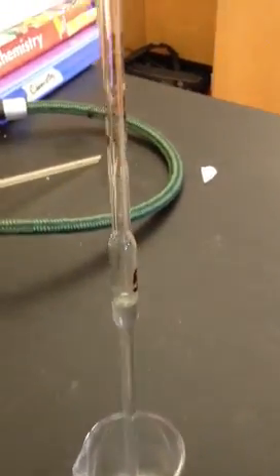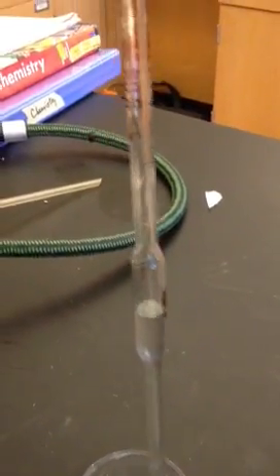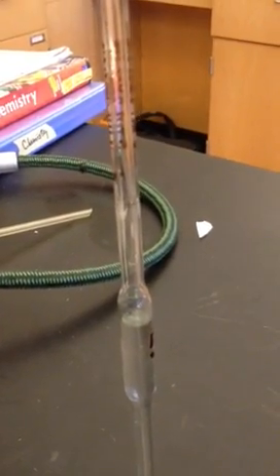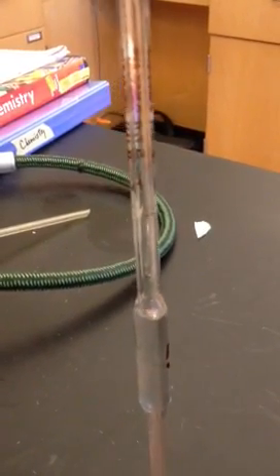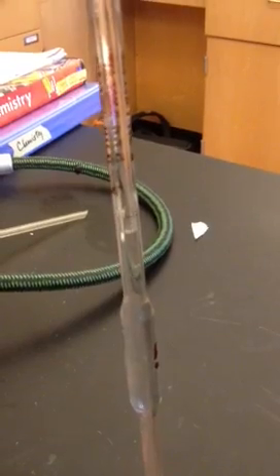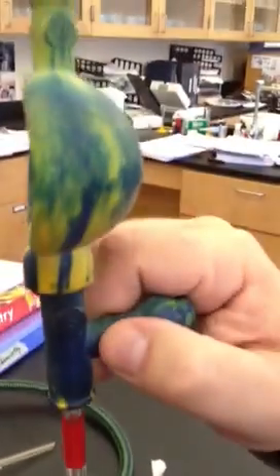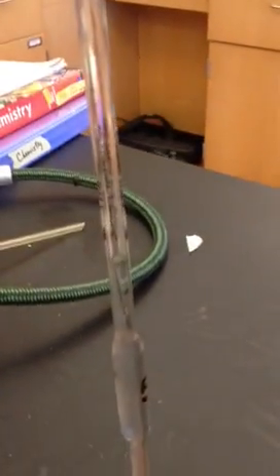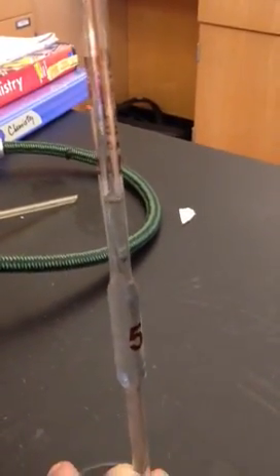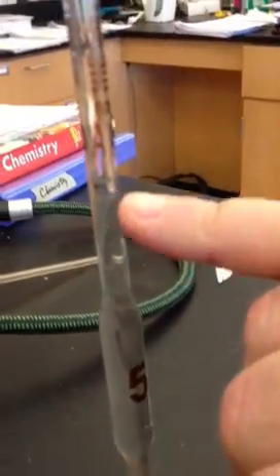I'm going to get eye level with the brown line. As it slowly climbs, it's getting closer. I went a little bit past, so I'm going to tap the E button to empty out just a little bit. Now it is at the right part where the bottom of the meniscus is at the top of the line.